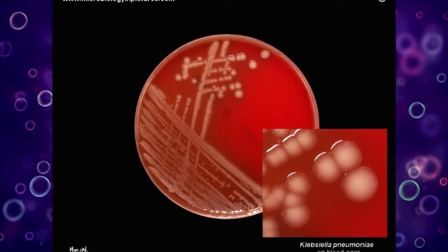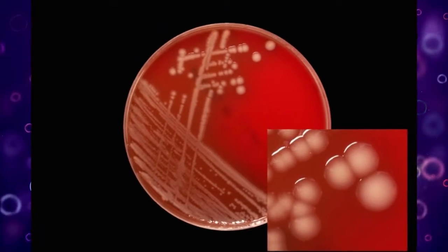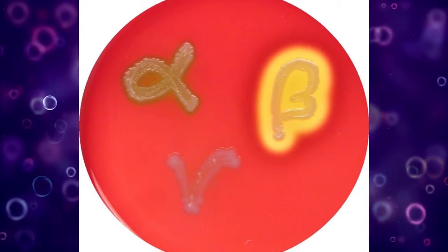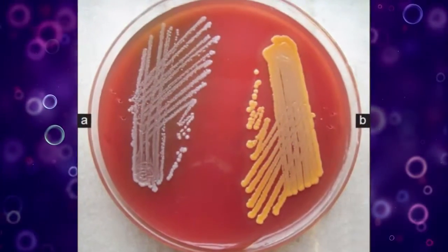Also, Blood Agar Media gives good colony appearance, hemolysis patterns such as alpha, beta, and gamma, as well as pigment production.